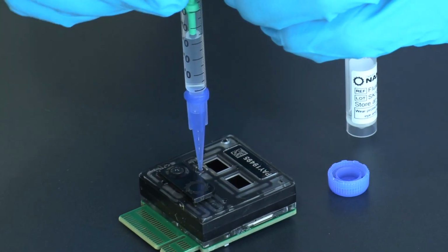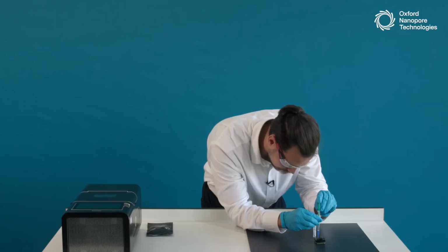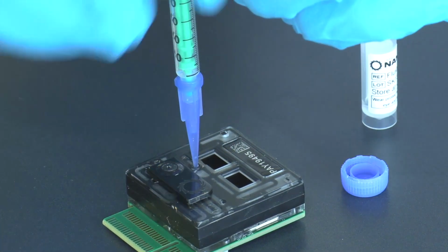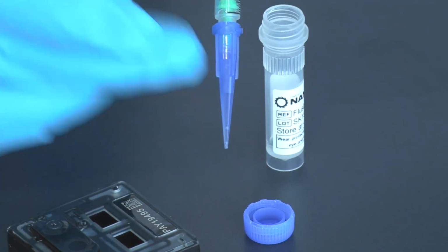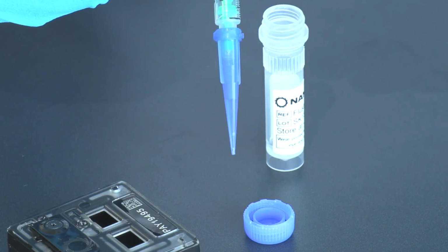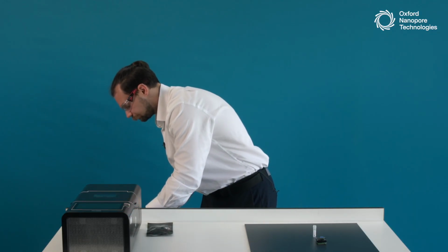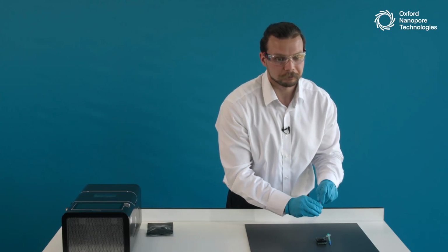So I insert my syringe in and carefully dispense the liquid using the plunger until about halfway down the pipette tip. Once again, I always leave a little bit of liquid in, so we can see we have liquid still present in the pipette tip. Hopefully everyone has done this part again. I will wait for everyone to finish in case you are still doing that. And at this stage, our flow cell is successfully primed.